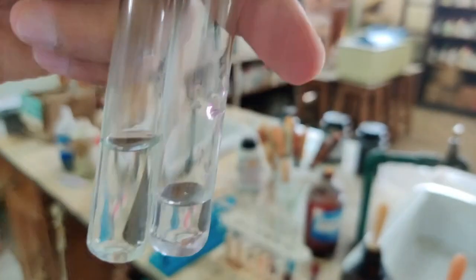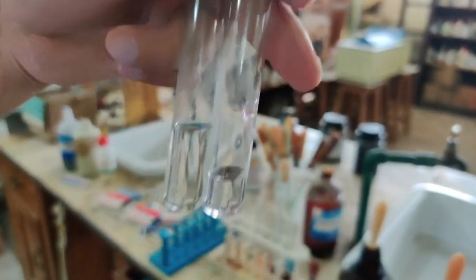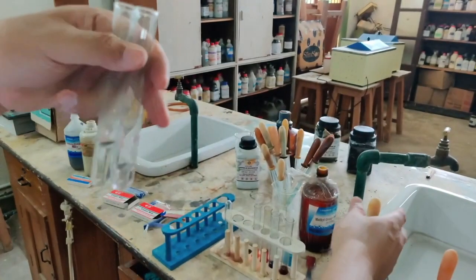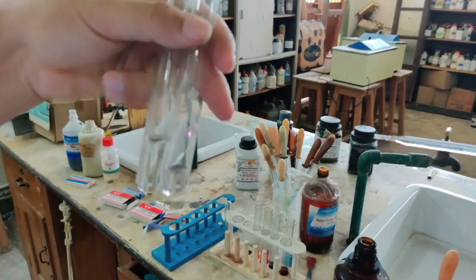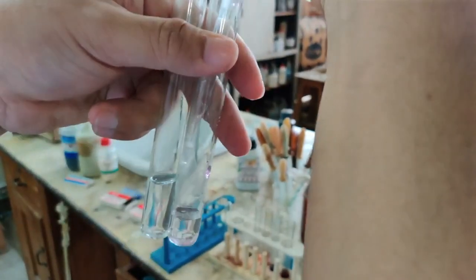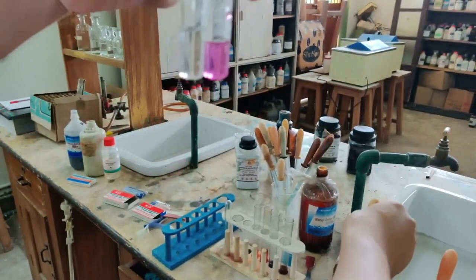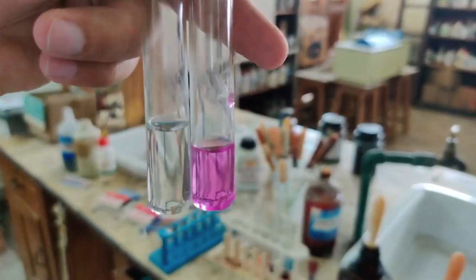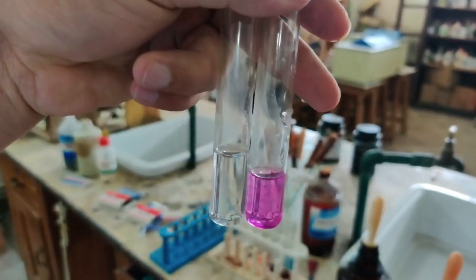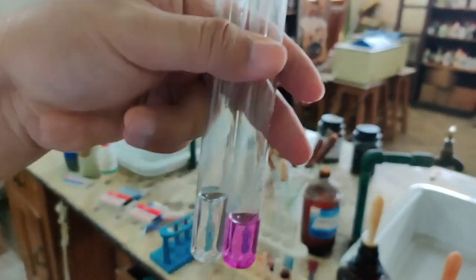Now the second test tube contains a very small amount of phenolphthalein, while the first test tube has become larger in volume because I added dilute hydrochloric acid. Now in the second one, let me add ammonium hydroxide. If I add ammonium hydroxide in the second test tube, see the change in the color that you notice. See there, a very nice color has come out. So phenolphthalein will turn pink when you are using a base. Phenolphthalein turns pink in a basic solution.